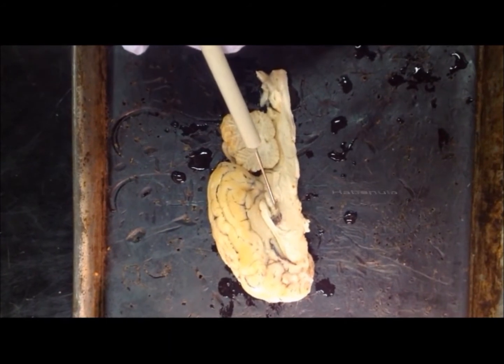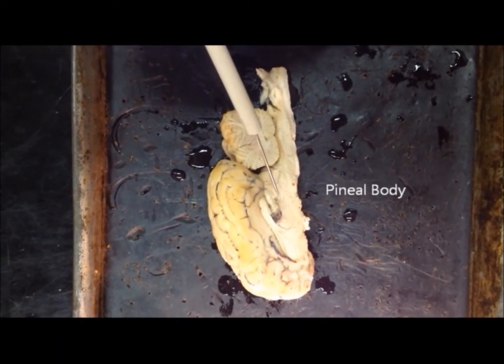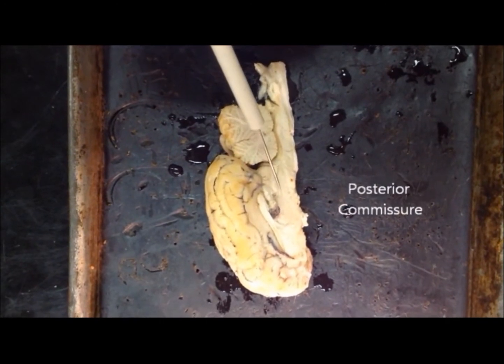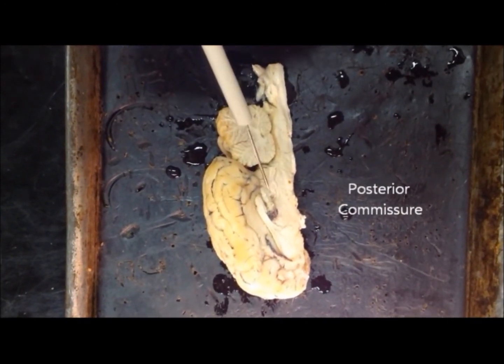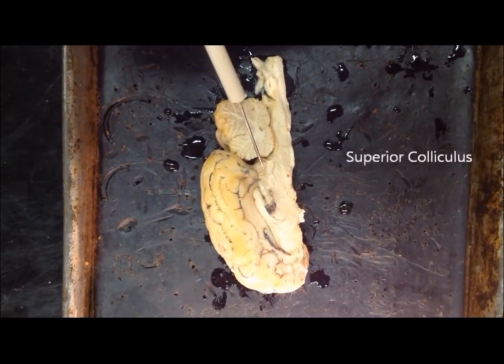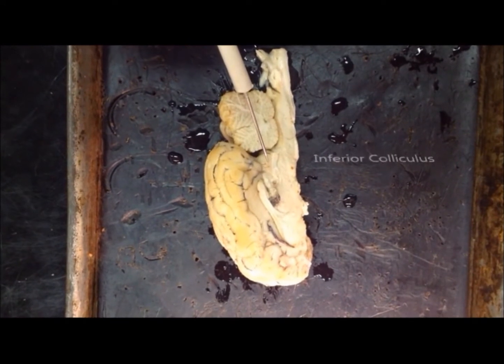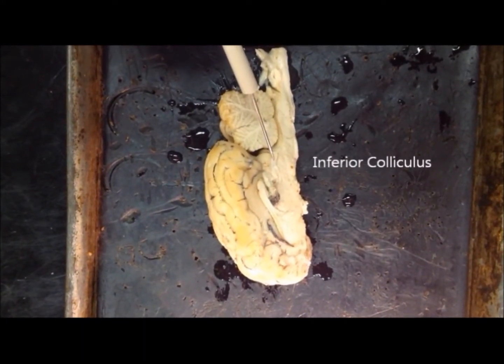Posterior from the habenula is the pineal body. Hanging down and ventral to the pineal body is the posterior commissure. Going back to the pineal body and moving posterior, we can see the superior colliculus. Ventral to the superior colliculus is the inferior colliculus.